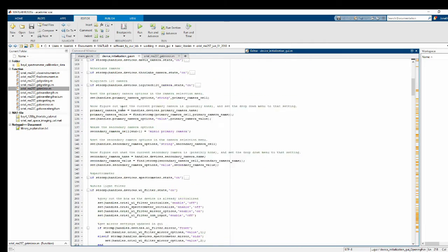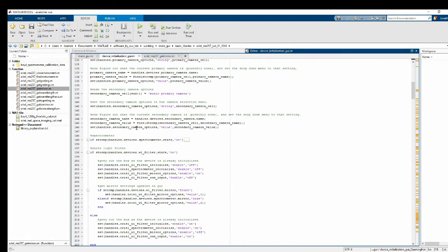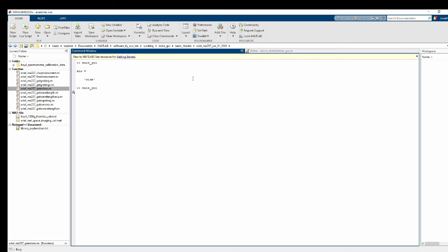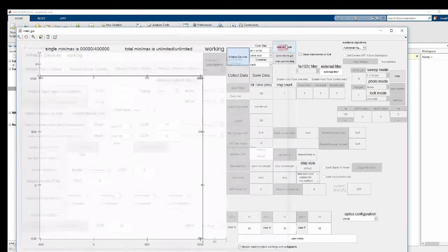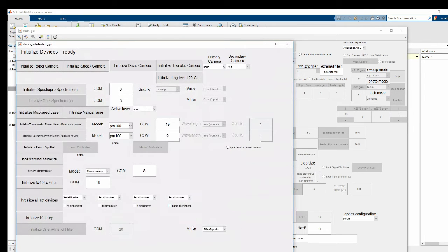So we go back to our opening function. And right here, where I wrote devices.spectrometer, I should have written devices.whitelightfilter. There. Let's go ahead and try it again. So I turn it on. That's grayed out. Good. This is available. Initialize it. Sets it to B port. Good, because that's what it's actually set to right now. And now if I do it one more time, B port. Good. So now it's displaying accurate information every step of the way.